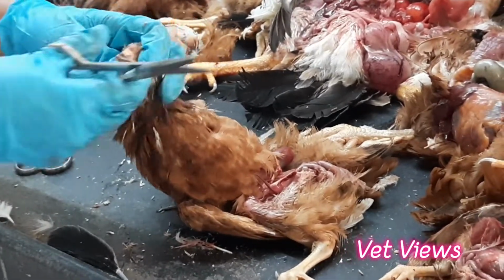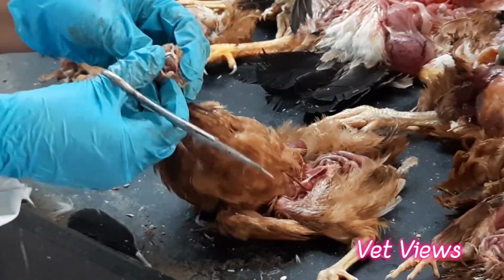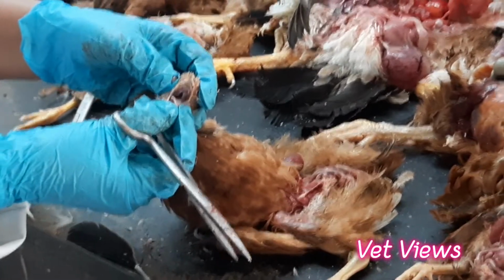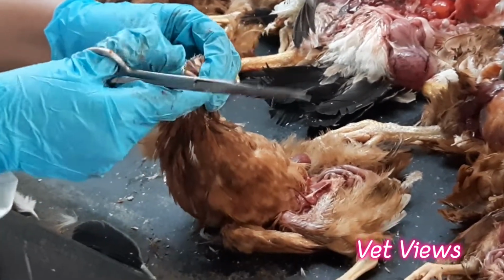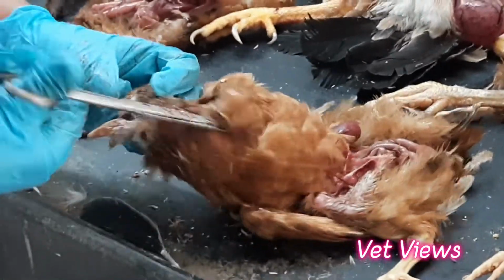But in the wet form, what happens? The diphtheritic membrane will be formed in the beak. So when you open, you can see the membrane. Okay? Also see the ulceration of the tongue or any changes. And in some fungal infections, you will see the fungal spread in the mouth also. After examining, just cut open the beak, then open.